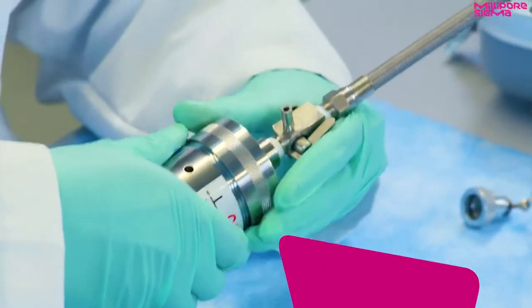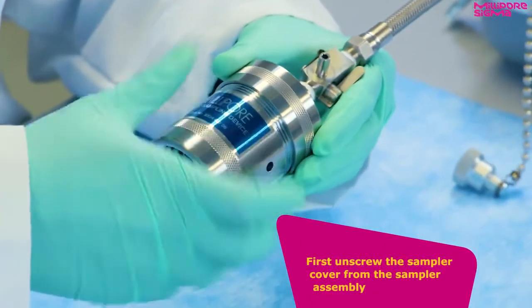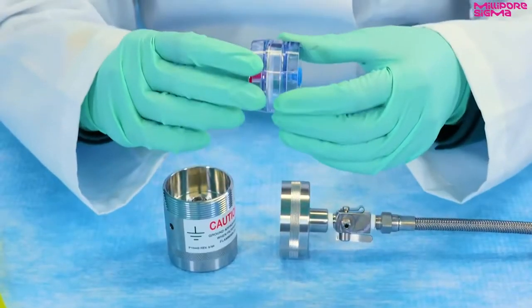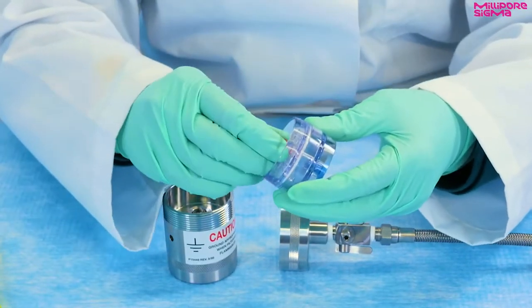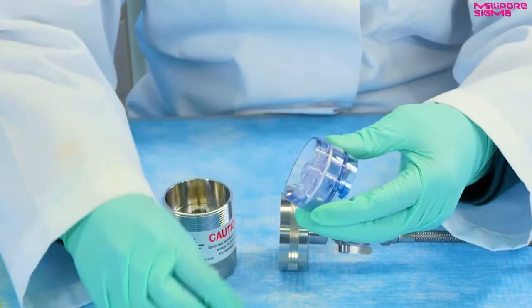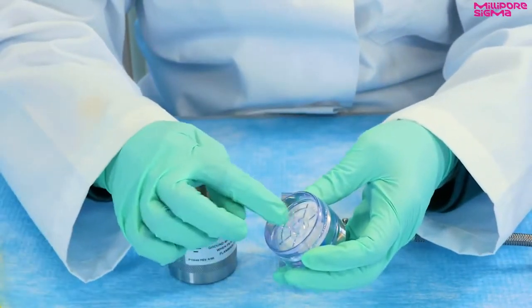To install the monitor, first unscrew the sampler cover from the sampler assembly. Then remove the protective plugs from the monitor. First the red plug from the bottom and then the blue or yellow plug from the top. Save the plugs for reuse.